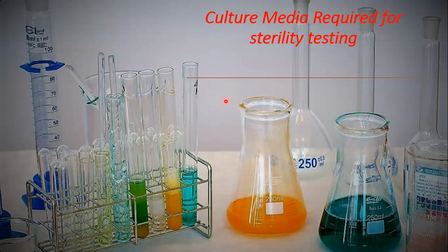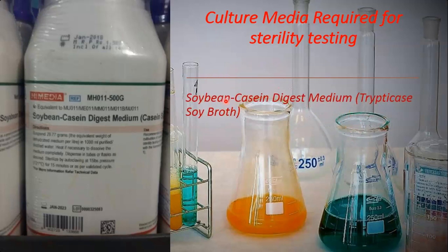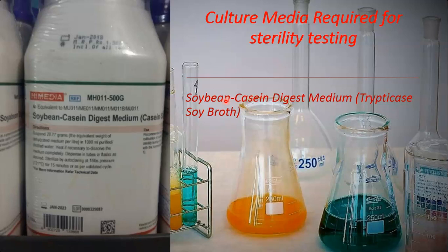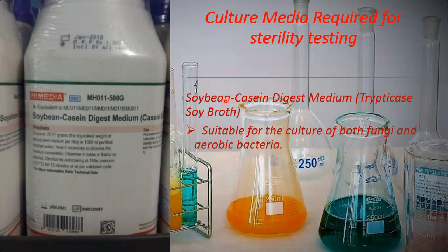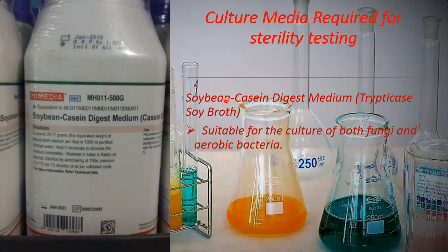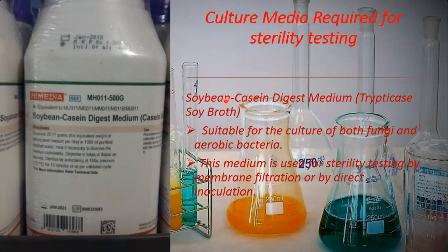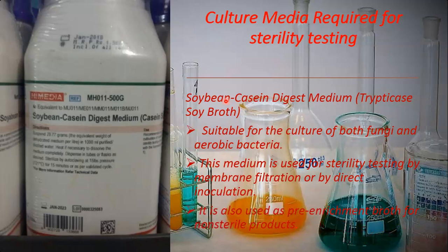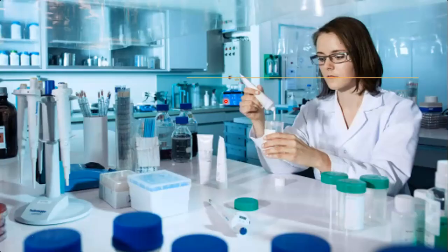The first culture medium required for sterility testing is Soybean Casein Digest Medium, also called Trypticase Soya Broth, or TSB. This medium is suitable for the culture of fungi as well as aerobic bacteria. It is used for sterility testing by membrane filtration as well as by direct inoculation method. It is also used as a pre-enrichment broth for non-sterile products.